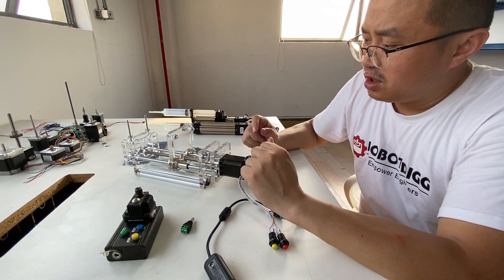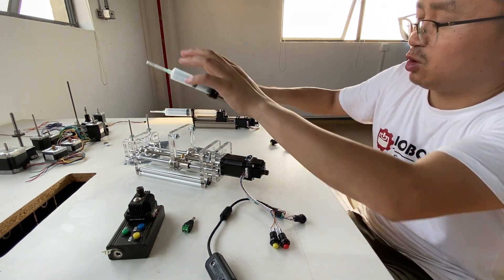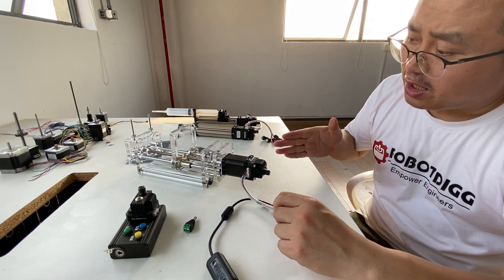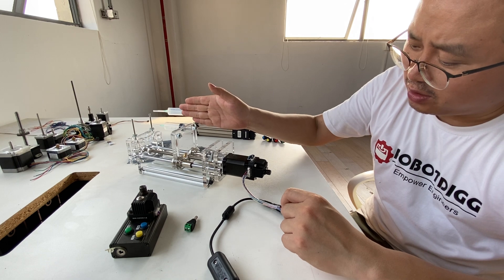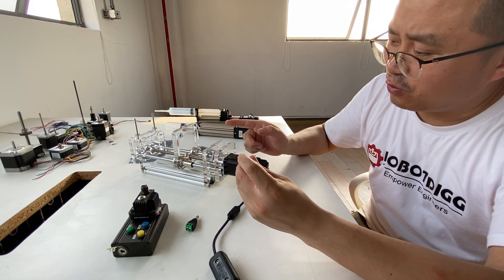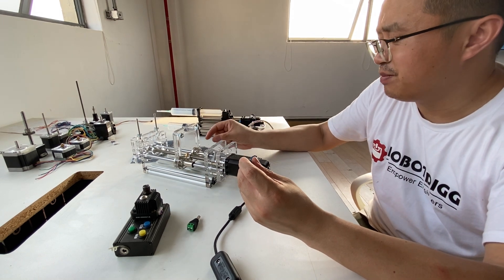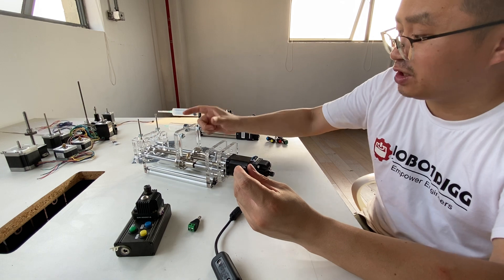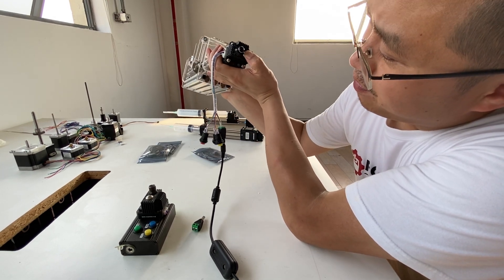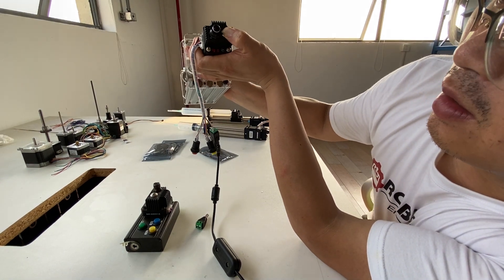The question is: how can I use this linear mode if we do not have such a setting here? Linear mode — so how can I just get this to go forward? Now when I click the button, it just goes backward or forward. Let's say 10 millimeters. Now I just want to change it to 20 or 30 millimeters. How can I do that? You can see here is the middle button — you just press the button until you read 'Y1' on the screen.